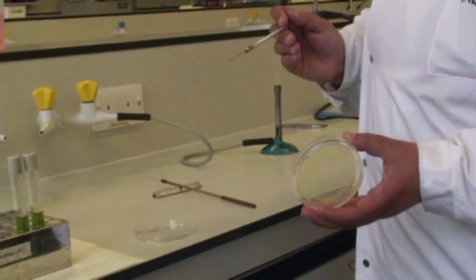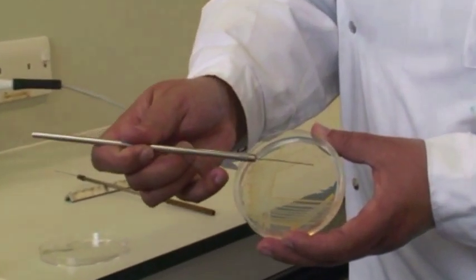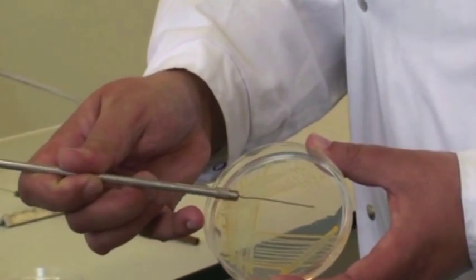So this is the bacteria on the agar plate, and I'm just going to pick one colony. That'll be sufficient.